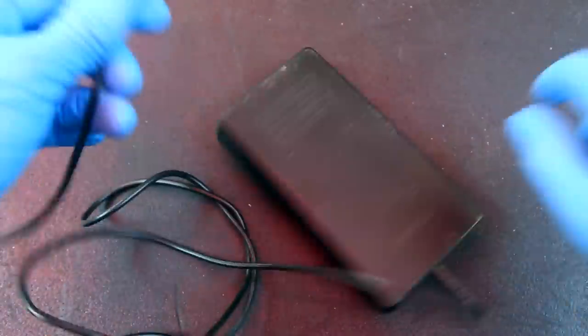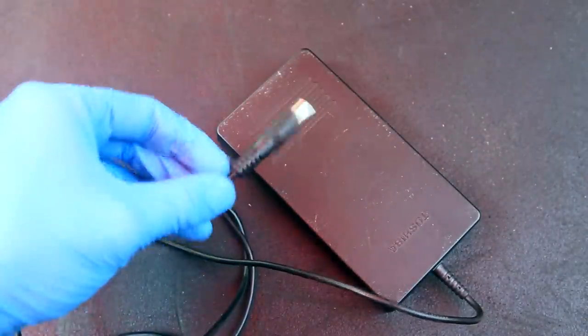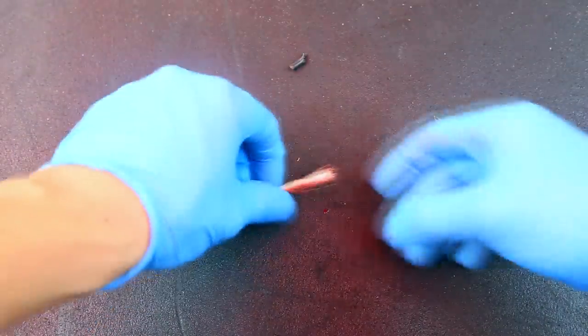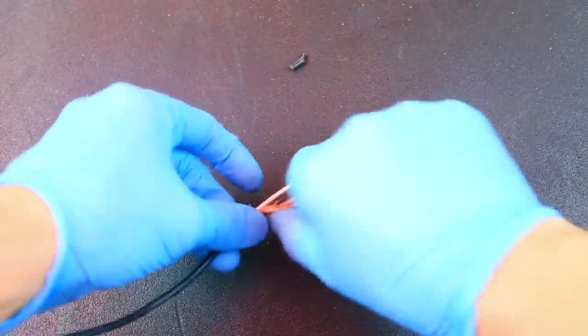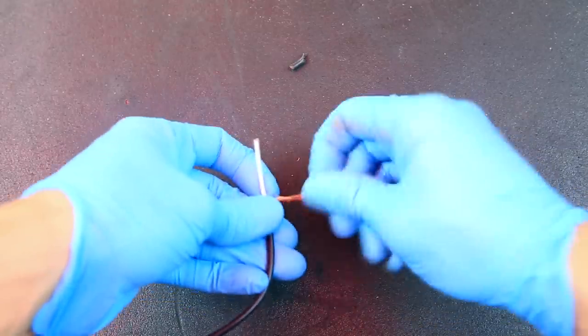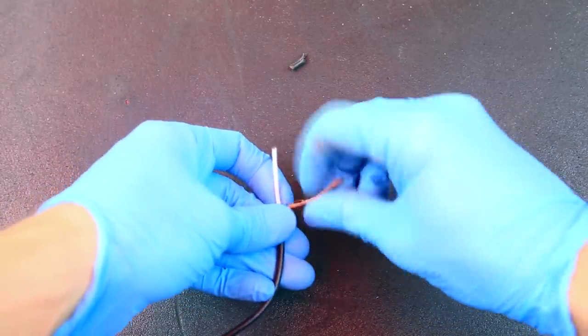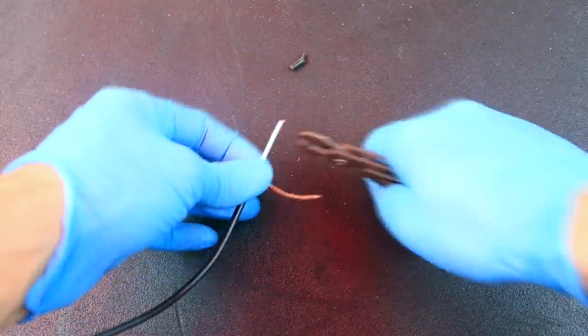So I found an old power supply from a laptop I used to have. I cut the end off and stripped away about an inch of the wire on the end. The free copper wire that you see wrapped around the inner white wire is generally the negative or the ground. So it was removed from the white wire and twisted up a little.